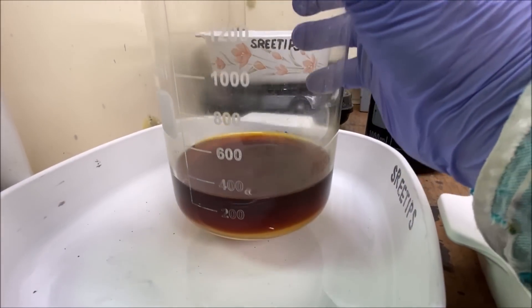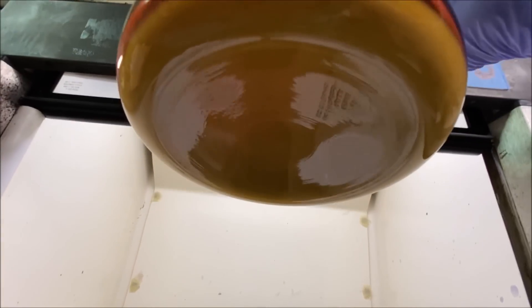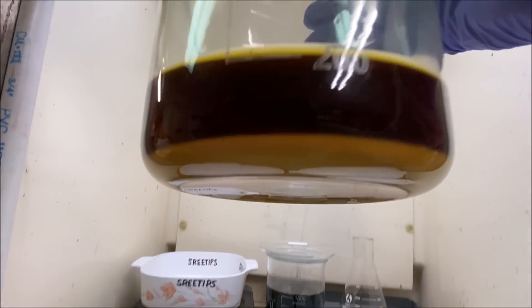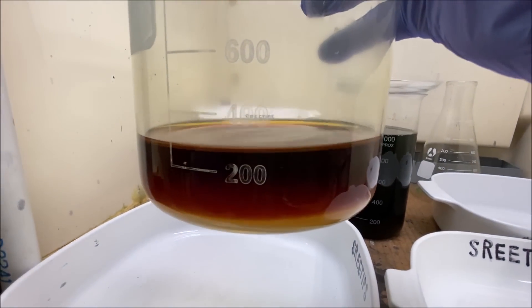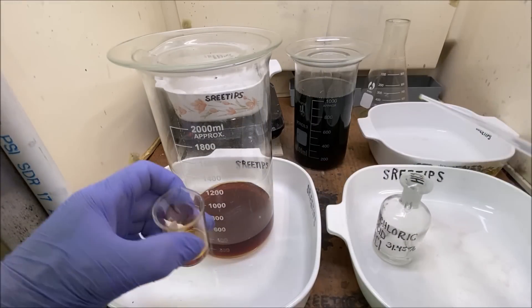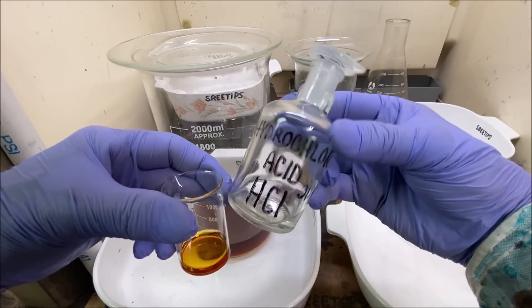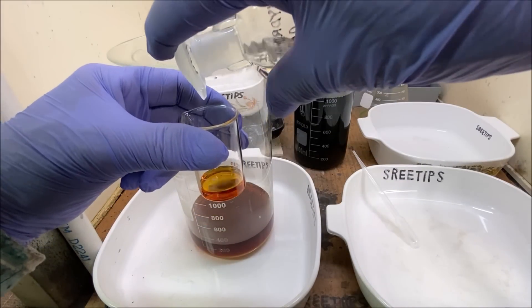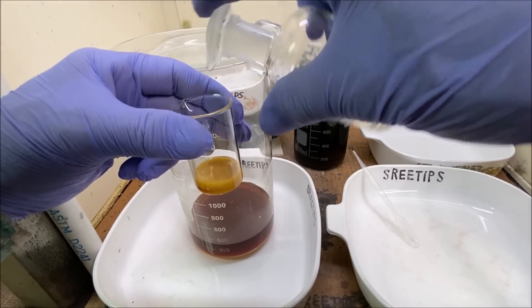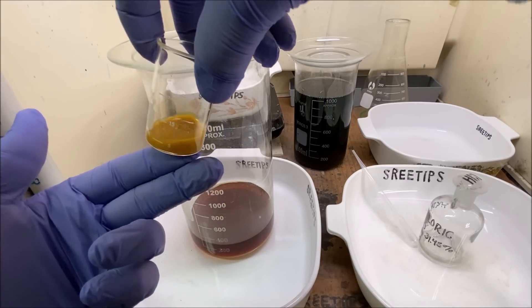Here's the stuff we boiled in hot dilute nitric to remove the silver. Looks like most of the silver is gone — I don't see a whole bunch of gray in there and all we have left is the precipitate. Now I'll drop a sample of that liquid, add a little bit of hydrochloric acid, and test for the presence of silver. As you can see, the hydrochloric acid reacts with the silver nitrate and forms silver chloride.